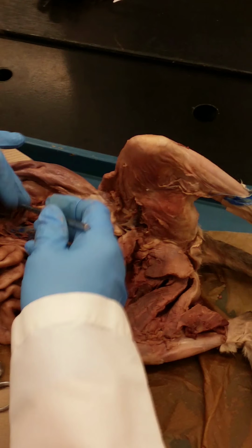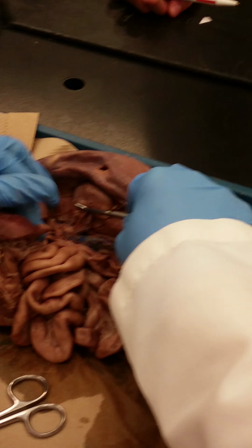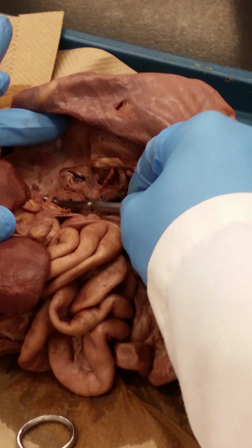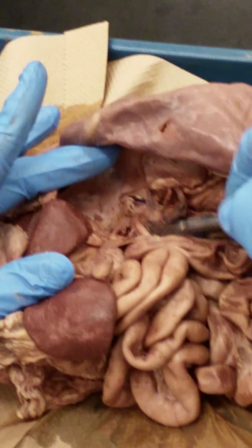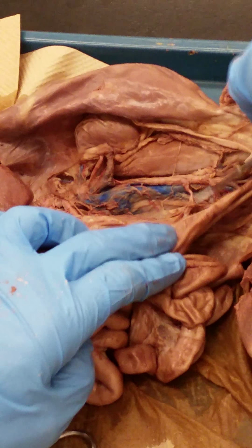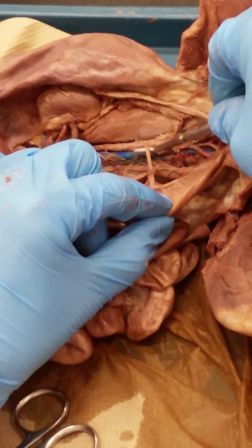So that's the aorta. If we go up and start with the most anterior area, these are much smaller than they will be in a larger kitty, so I strongly recommend that you look at a bigger kitty too. Okay, right here, this one here that's going up to the stomach region would be the celiac artery. The one just posterior to that that's going to the mesentery of the small intestine would be the cranial mesenteric artery. And then if we jump down here to the one that's going to the mesentery of the colon, that would be your caudal mesenteric artery.